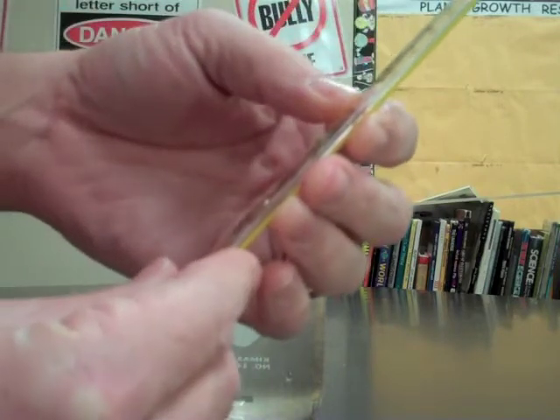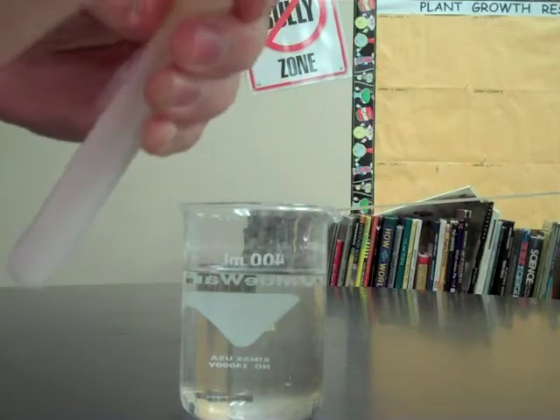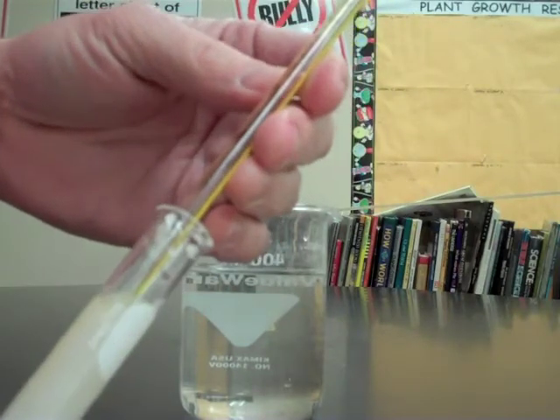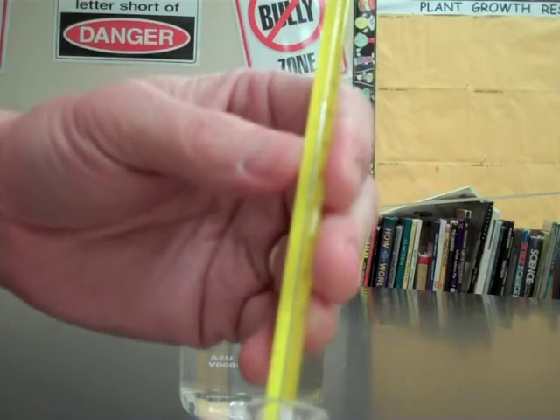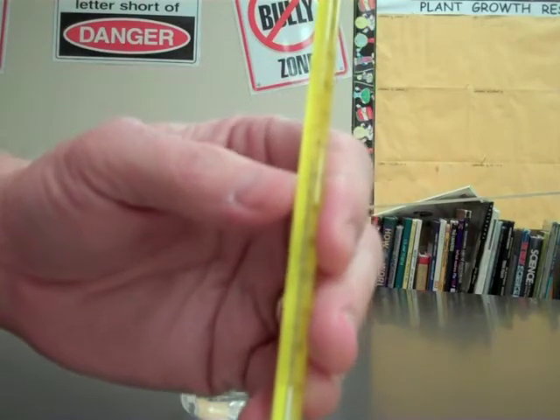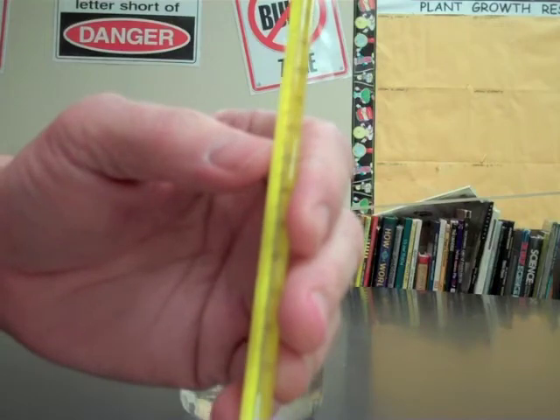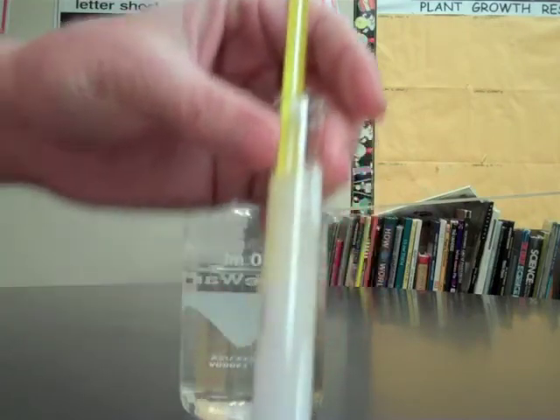Sorry, that's 50 degrees. It went up to about 50. Let's go down into it a little bit further to see what that temperature is. The temperature right now is still rising. Now it's about 58 degrees. Remember we started at 20 degrees.